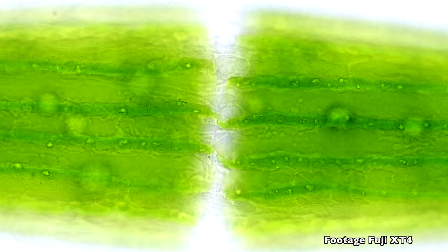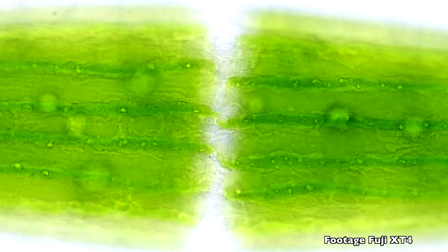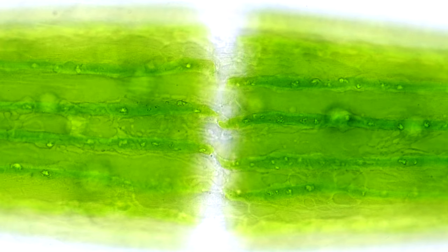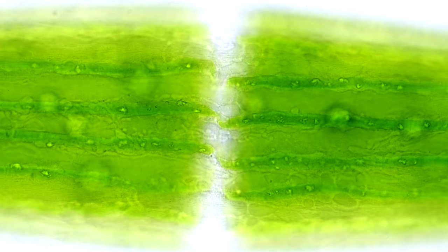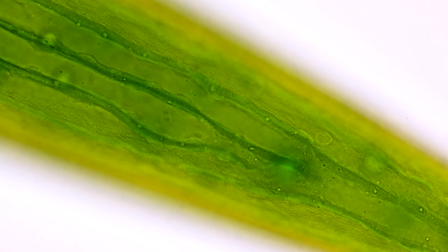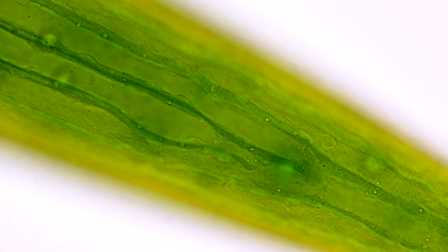This alga is Closterium, one of the algae I really love. And the camera really manages to reproduce the colors as they are in reality. There is not much difference to how you see it through the microscope. Until now, I was very happy with the footage that the XT4 produced. And to my eye, it looked better than the Sony cameras.